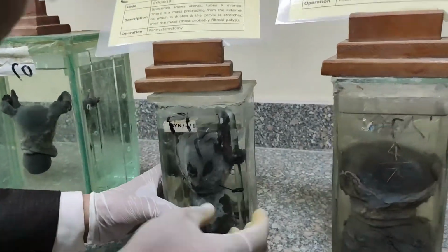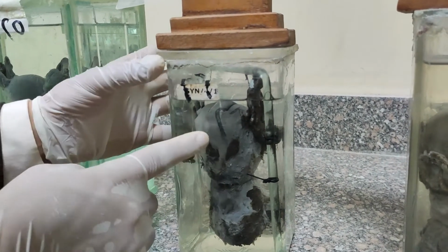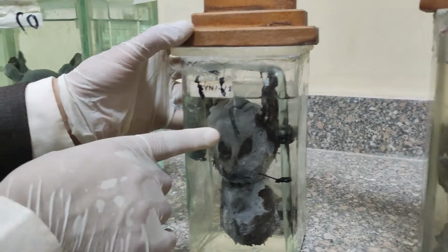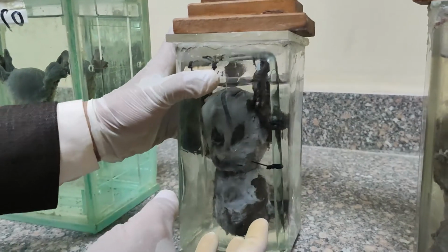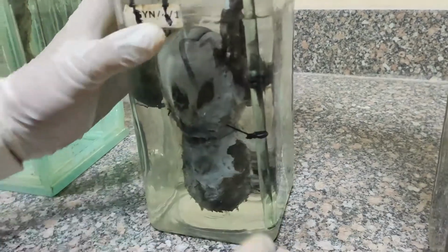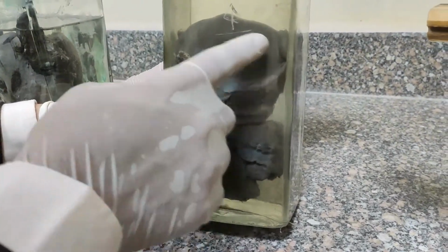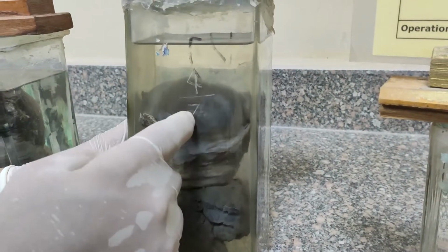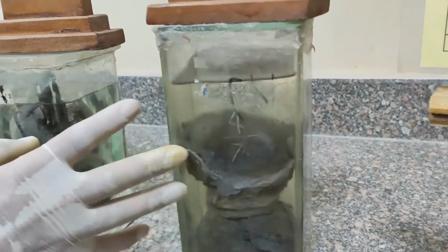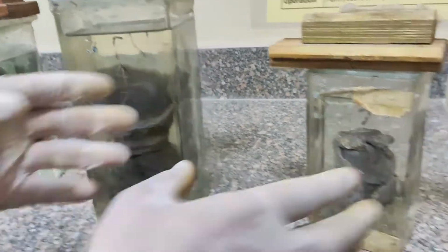This jar is again the same, but the uterus appears more enlarged than before. So this uterus may contain an interstitial or submucous myoma inside, but this is a large cervical fibroid polyp. A large cervical fibroid polyp protruding from the cervix, associated with an enlarged uterus. For all of these, the operation done is total abdominal hysterectomy and bilateral salpingo-oophorectomy.